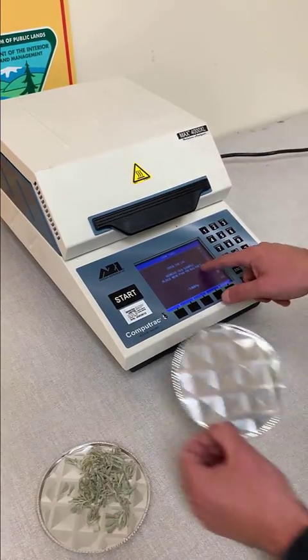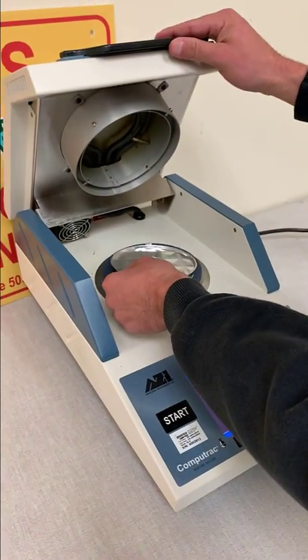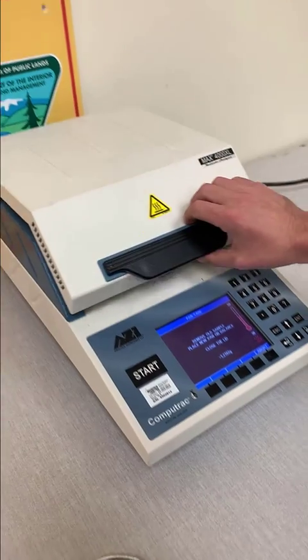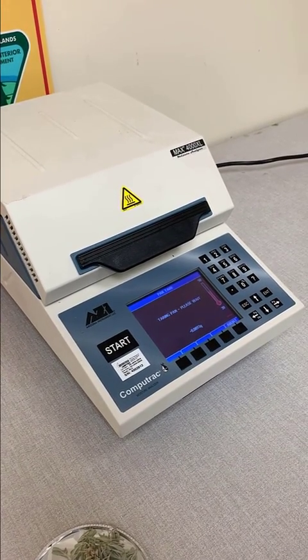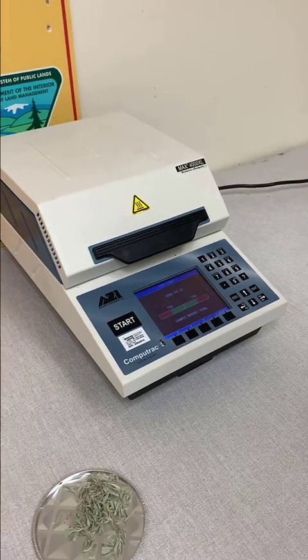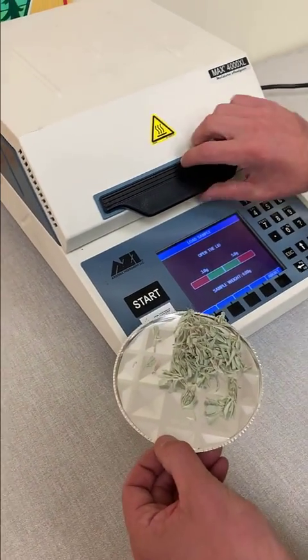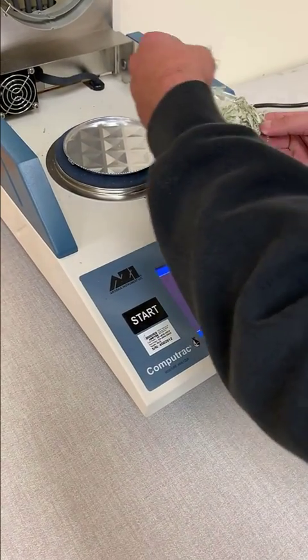At this point, as you can see, the piece of equipment prompts us to open the lid, place our empty pan onto the scale, and then close the lid. At this point it will start zeroing out the weight of the pan, and this sample will only require us to submit three to five grams of sage. So we have our sage leaves and we will go ahead and add them on diligently with clean, dry hands.